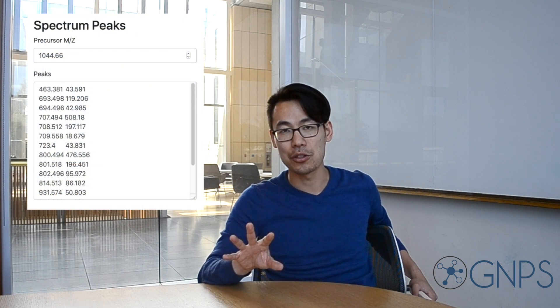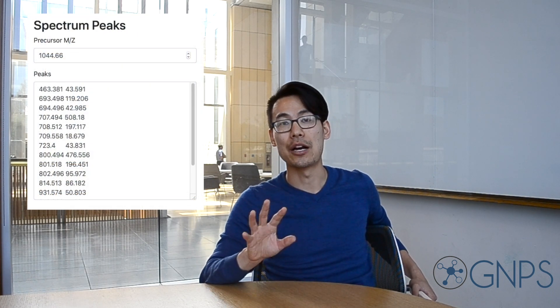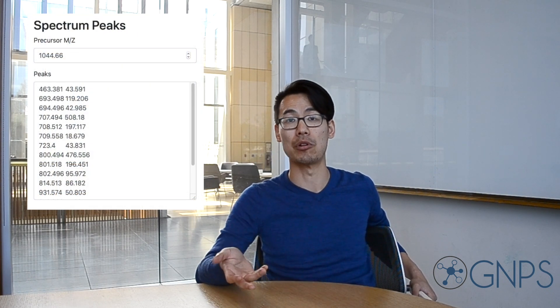Once you have that, paste it into the interface. First paste in the precursor m/z at the top, then paste the actual fragmentation peaks — one peak per line. Once that's in, you can enter all the optional parameters. For your very first search, leave them as default.